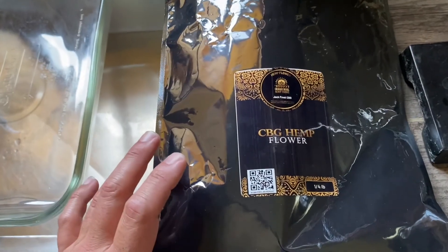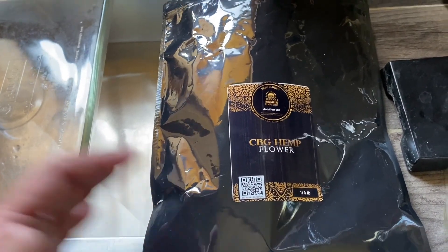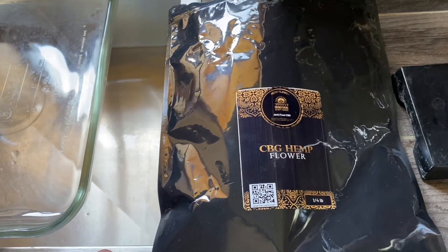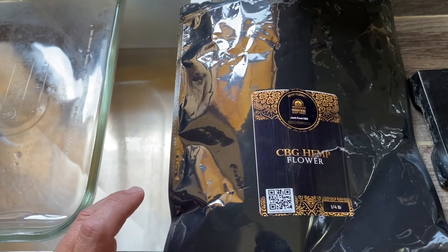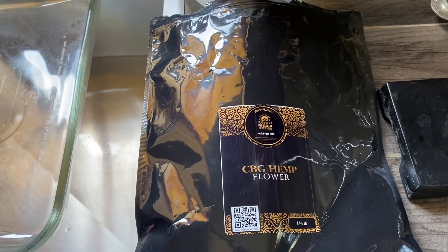Now there are a couple of things I want to point out about this. First of all, this is not cannabis sativa. It has less than 0.3% THC — Delta 9 THC. So this is legal in my state, and I have to make that disclaimer.